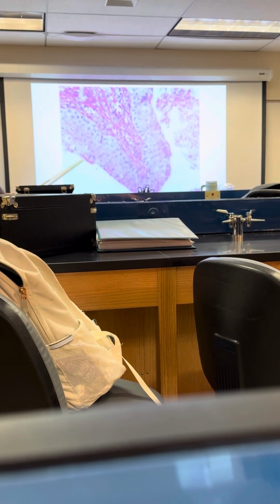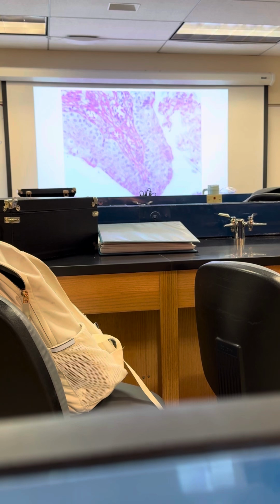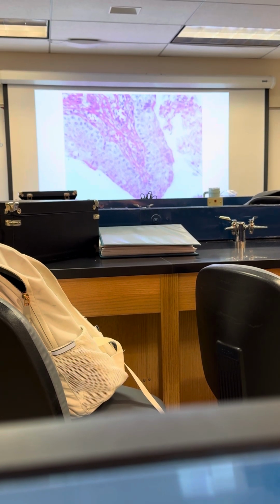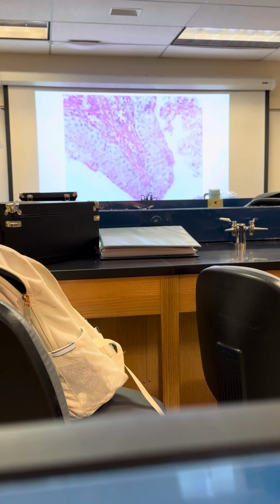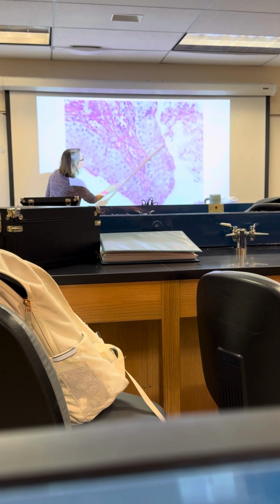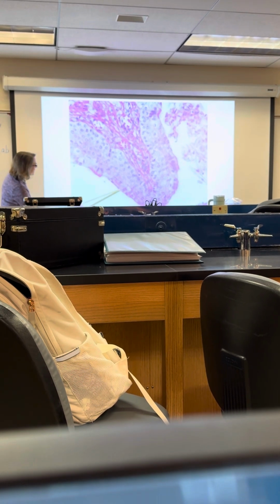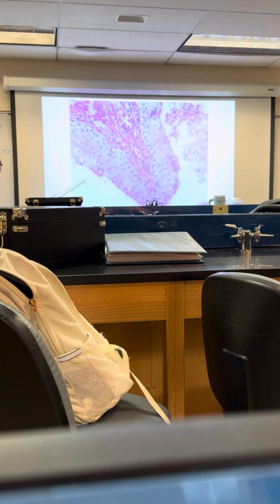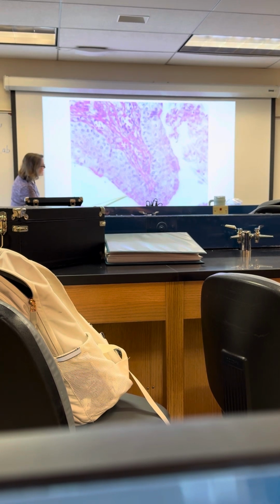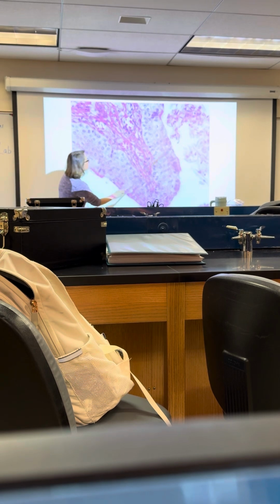It is stratified. And what's the shape of the cell at the apical surface? So this is the apical surface here, right? This is actually a stratified squamous, because when you start looking at these tissues here and here, these cells are flat. You always look at the ones closest to the apical or free surface. And since they're flat, it would be a stratified squamous epithelial tissue here.